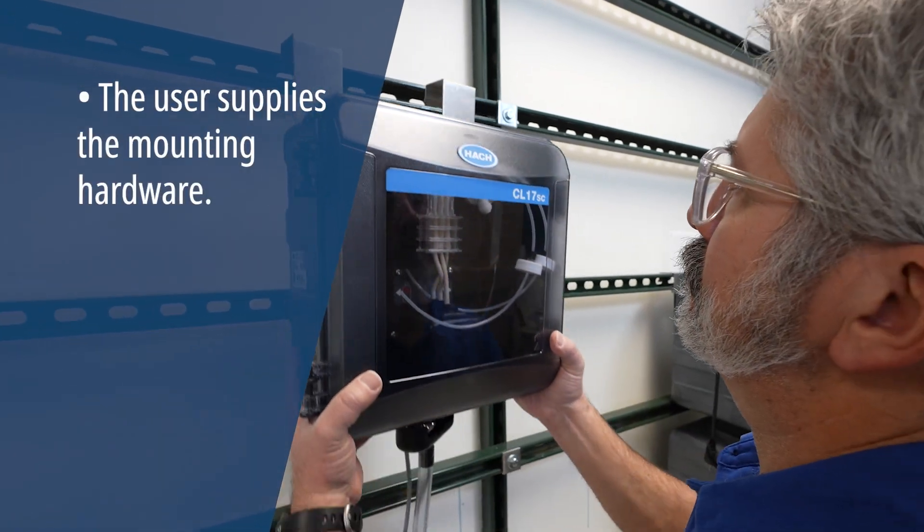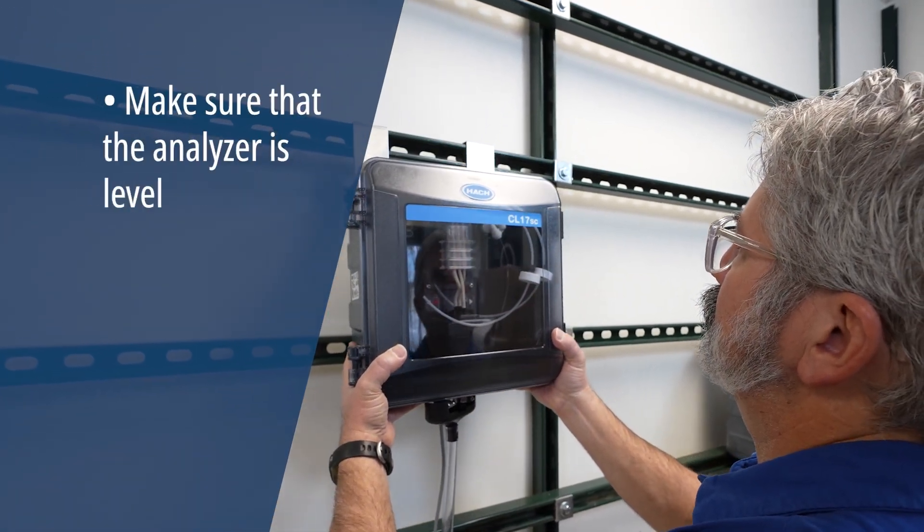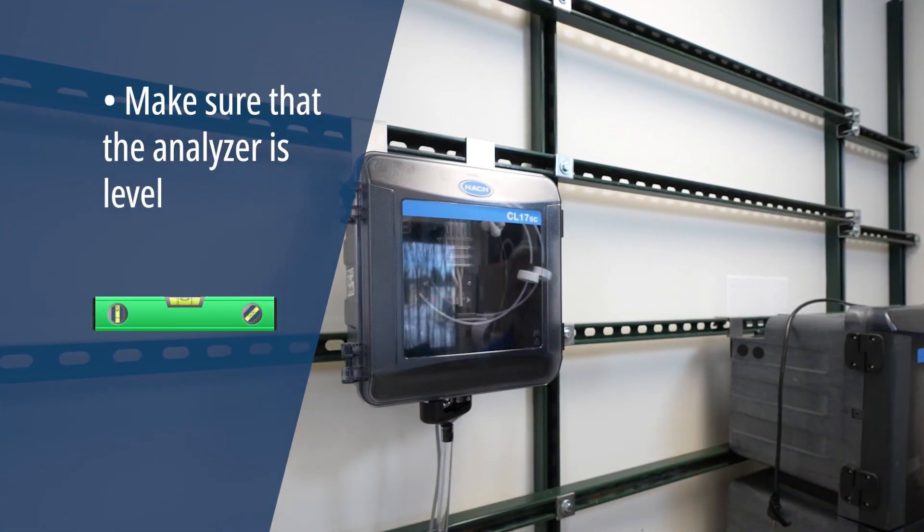Attach the analyzer to a wall using your preferred mounting method. Make sure that the analyzer is level.